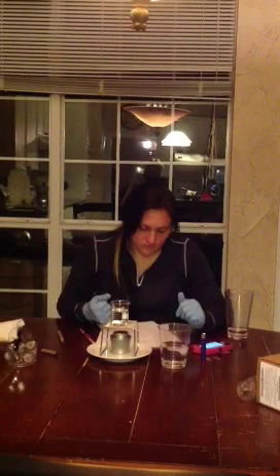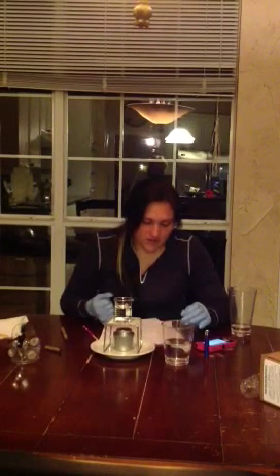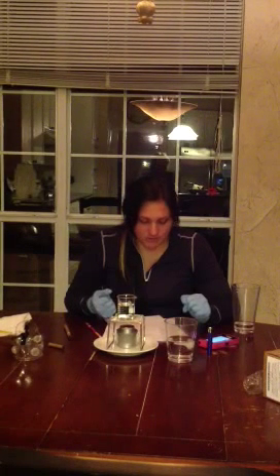Okay, just to summarize, all we did so far was just a simple start of the data table 2, and we recorded our measurement, which is 30.1 degrees Celsius. So apparently our tap water at our house is not actually that hot, due to it being similar to the regular tap water temperature.